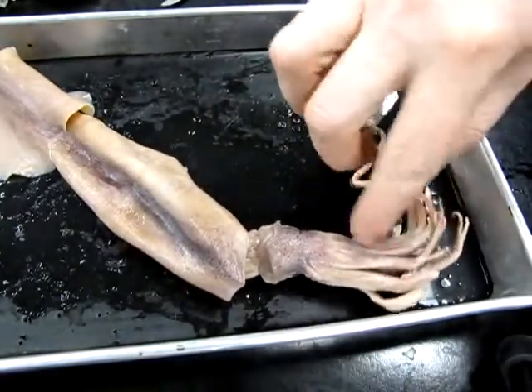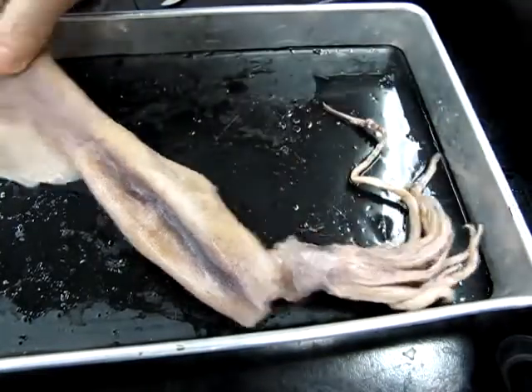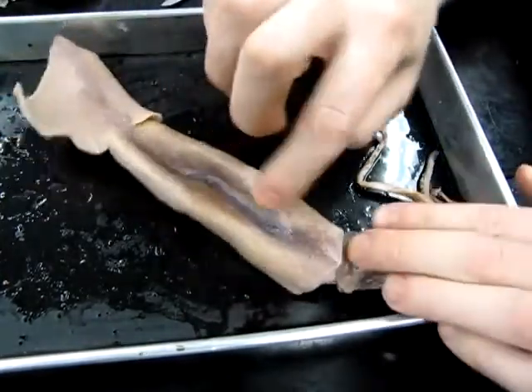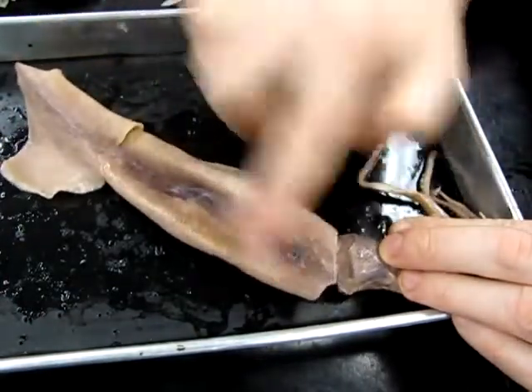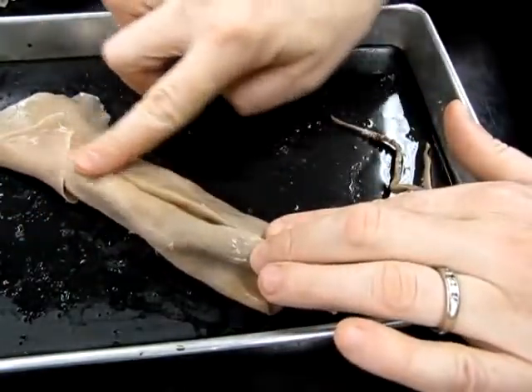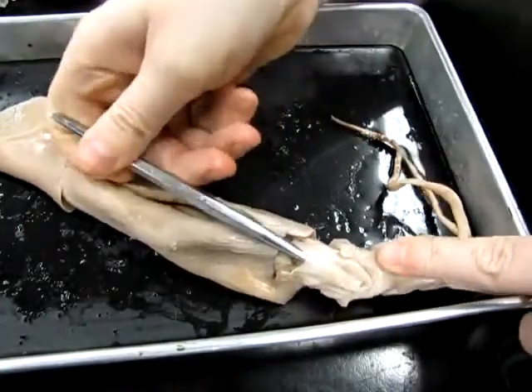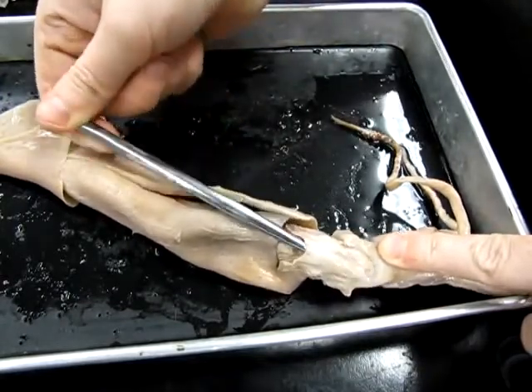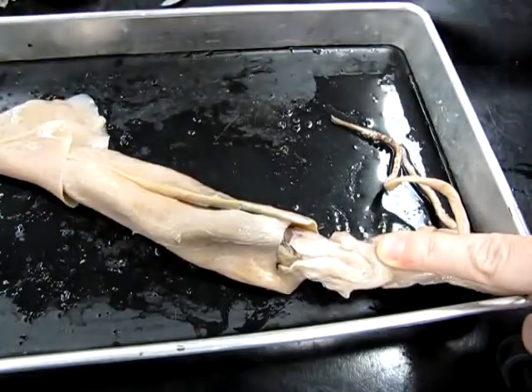Okay, so that means that this is then the ventral region of the animal down here, which makes this other end the dorsal region of the animal. This surface here, the one with the little point, is the anterior surface. So if we flip it over, then we know that this side, the opposite, must be the posterior surface. And the clue there is the presence of this siphon. That's the funnel through which water is ejected, and ink is ejected, and gametes are ejected. This is a multi-purpose siphon, and that's on the posterior side.